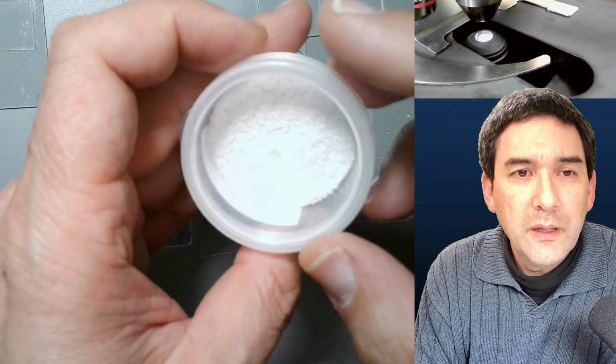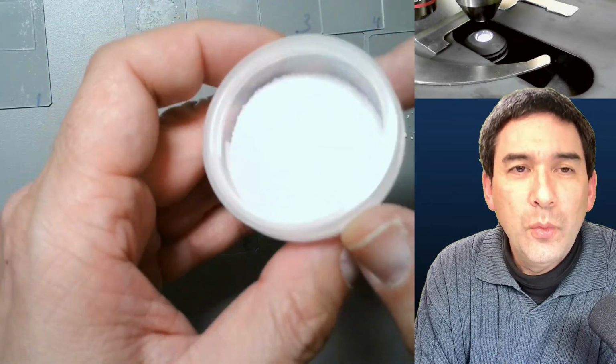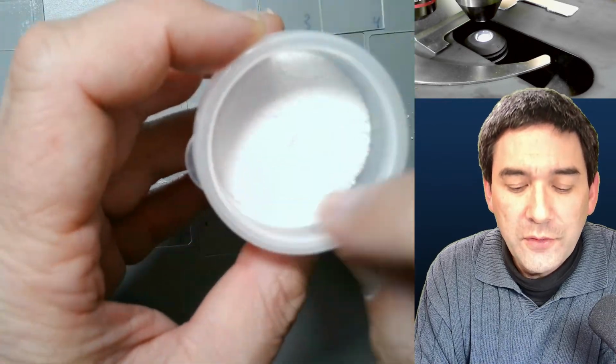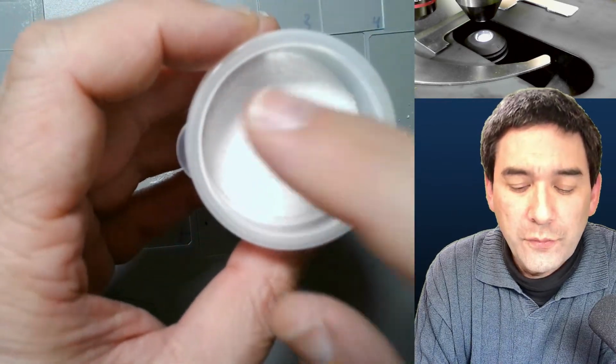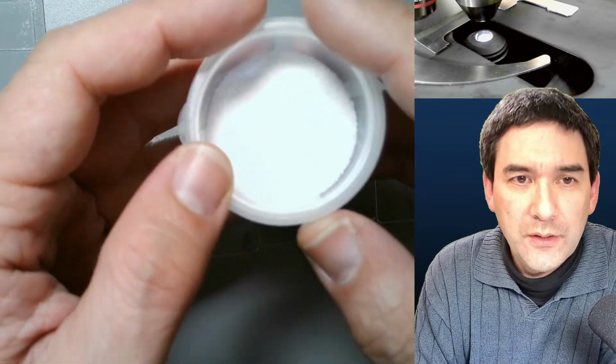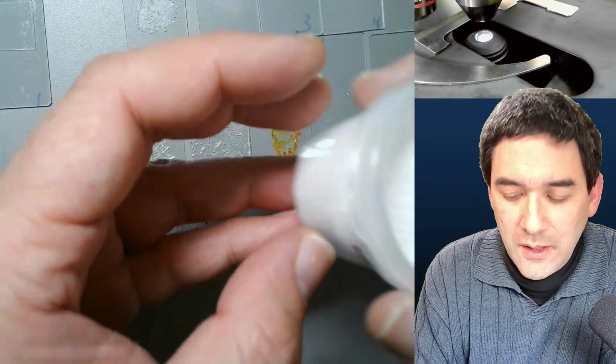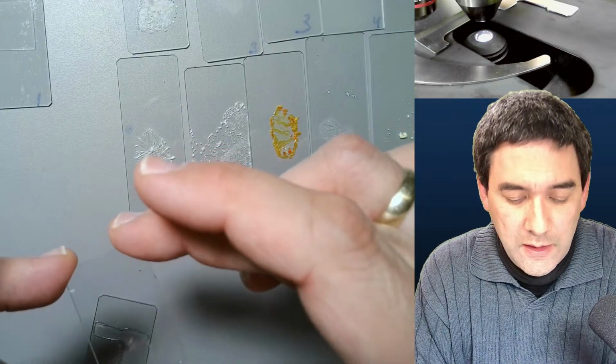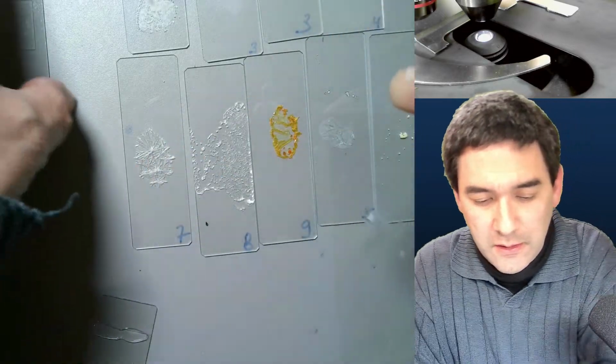Okay. And it dissolves extremely well in water. I was actually quite surprised. Yeah? And therefore you always have to keep it closed to prevent moisture from actually reaching the substance. Okay. So I think it's very difficult to crystallize, but it does work if you heat it up. Okay. Let me put this away.